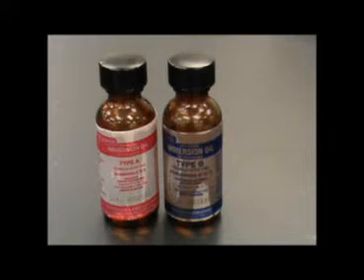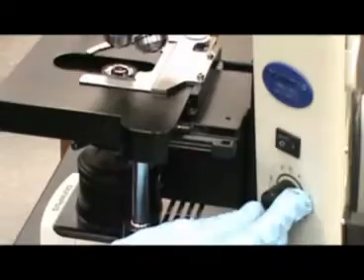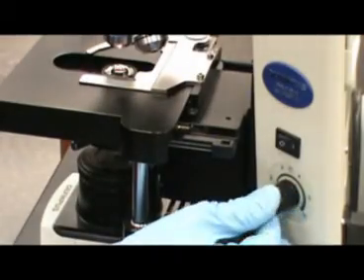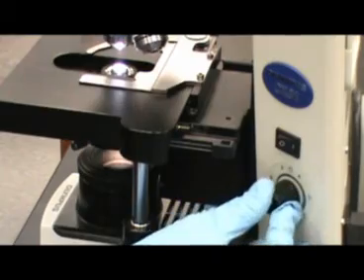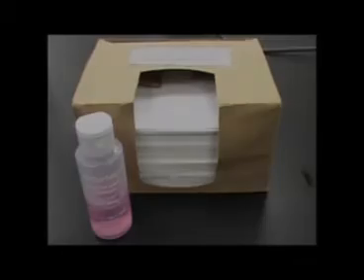Whatever type of immersion oil is available in your lab is fine. Notice here that the 100x objective does not come into contact with the slide. And when using the 100x objective, you will need to turn your light source to its brightest. This is the same slide observed before with the 100x objective for a total magnification of 1000x.